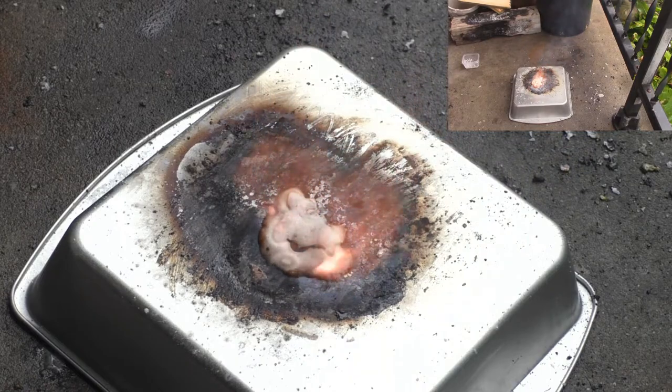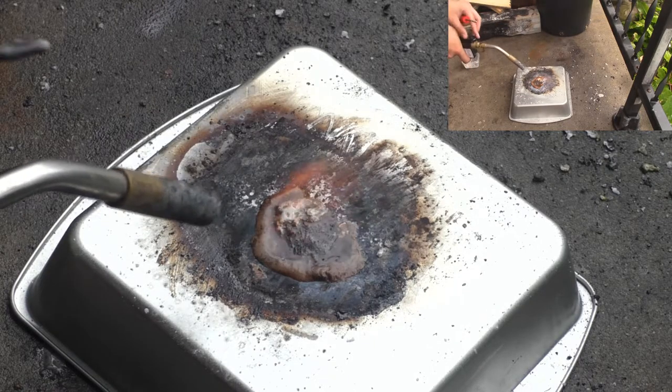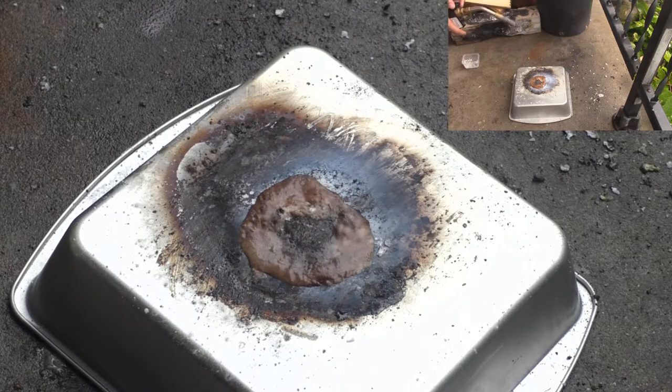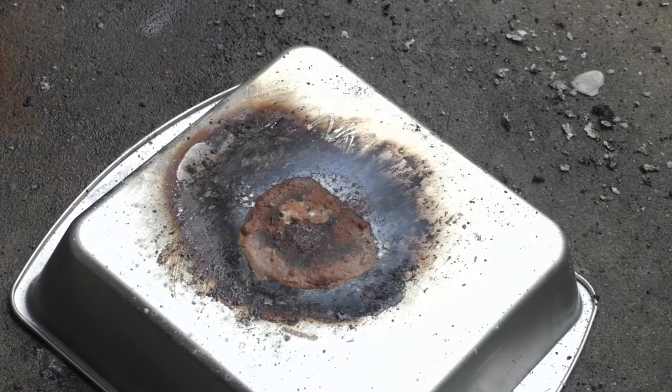Sorry, my dog was scratching in the background. Okay, so is that all it's going to do? Yeah, it doesn't seem like it did too much. That's just the potassium chlorate left behind, boiling away or decomposing.